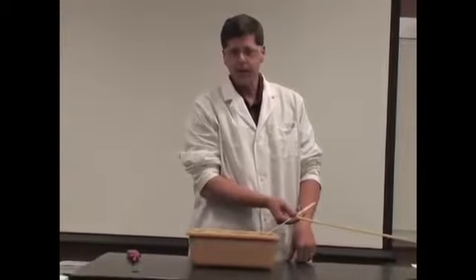So we're going to learn, you probably already know about the different states of matter, solids, liquids, and gases. We do a lot more with those states of matter when we get to chemistry. So liquids, I've got some liquid here. I'm going to use some gas. I'm going to generate some bubbles. I'm going to do a demonstration for you that is called methane bubbles. While I'm talking here, I'm going to generate some bubbles in my little solution here. So I'm going to go off camera here for a second, and you're going to see some bubbles forming.